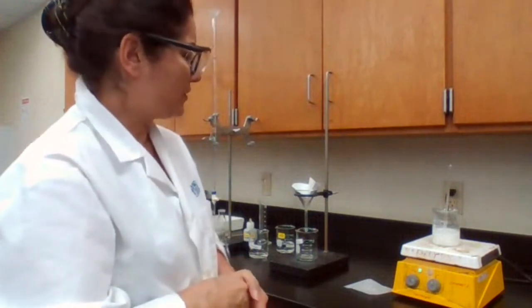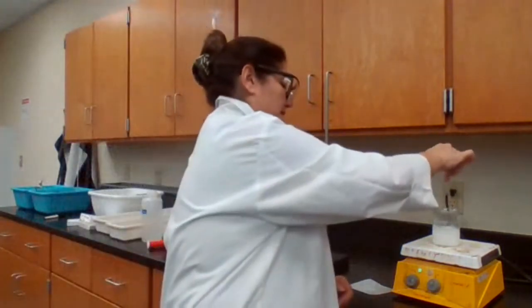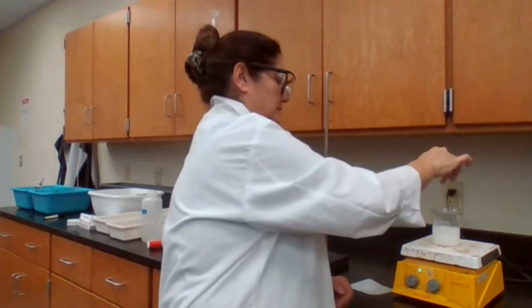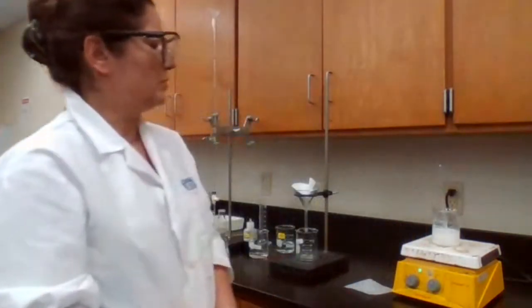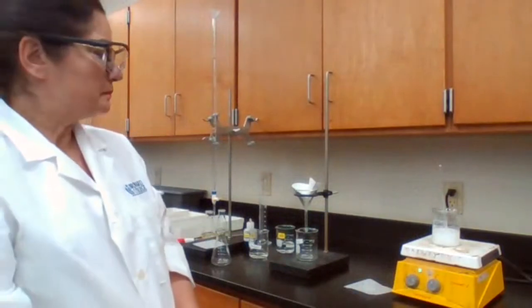Stay for the 5 minutes. It hasn't been 5 minutes yet. It's been 3 minutes. I'm keeping the time from the clock on the computer. So I have the sample for 3 minutes. I continue with 2 more minutes of heating up.